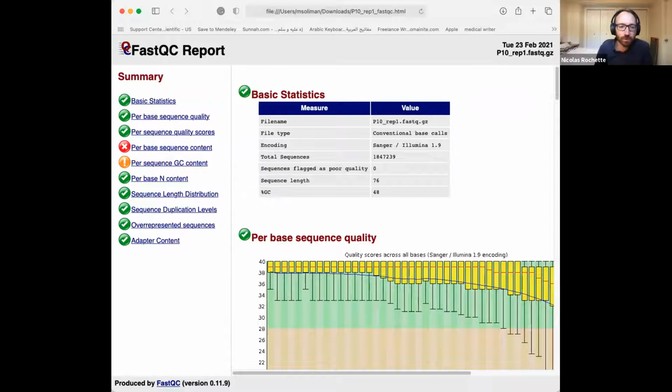Yeah, and so this is sort of what the output looks like. So you have these sections. On the left, you have an outline of the different sections. So you have statistics, per base qualities, per sequence qualities, and they're all either box plots or histograms. And the first thing just confirms which file we're talking about.